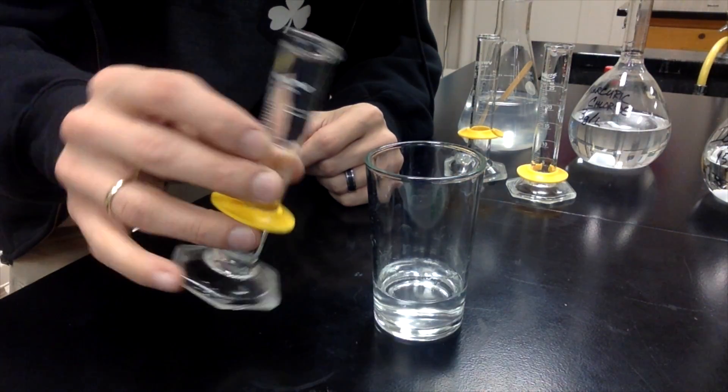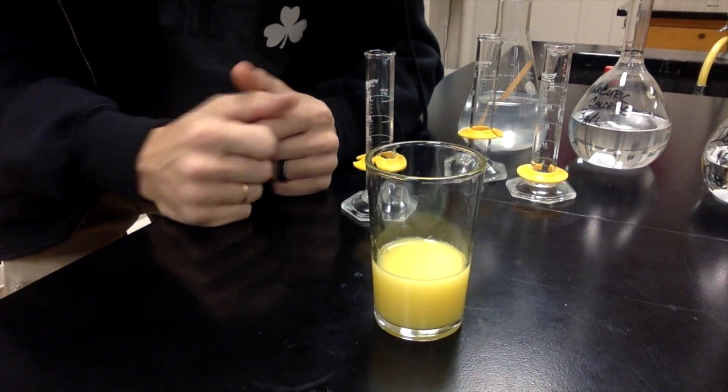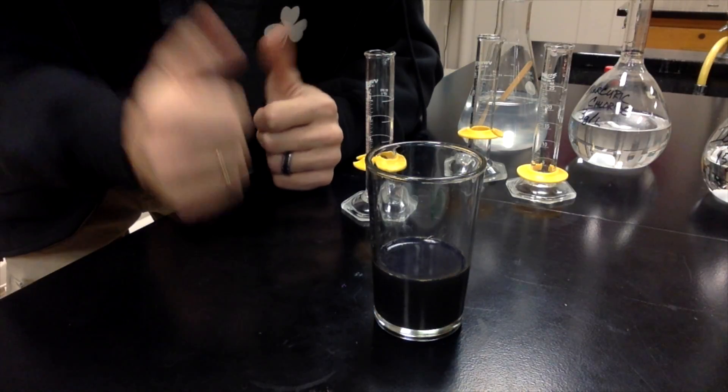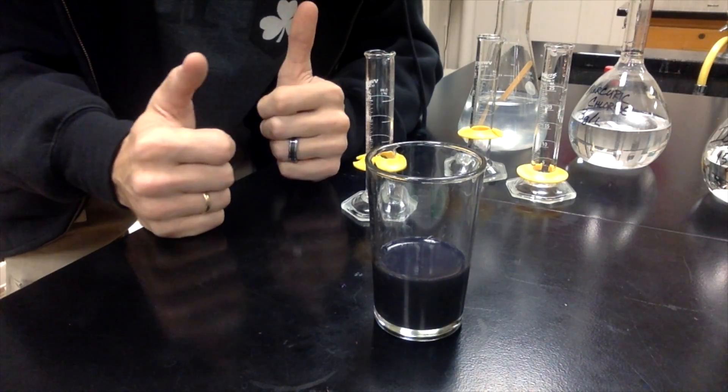But as soon as we pour it in there, if we just have a look and kind of keep watching, some things will happen. It'll go orange and then eventually it will go black. So that's why this is my Halloween demo - orange and black, right?